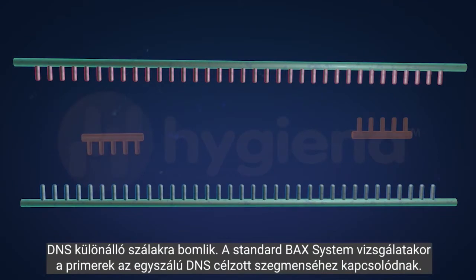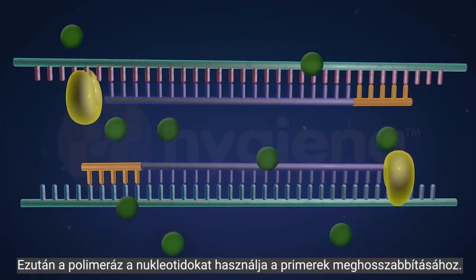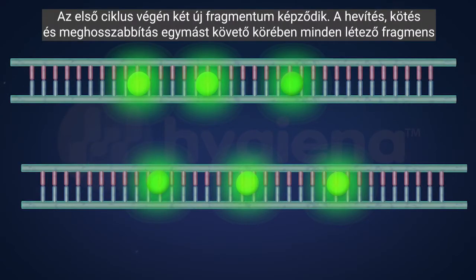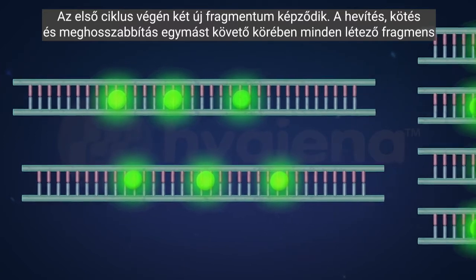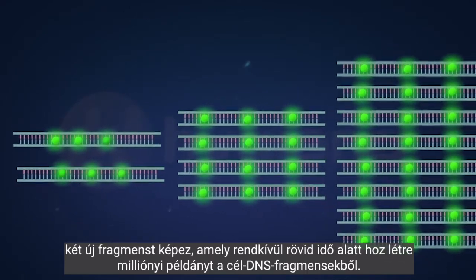For standard BAX system assays, the primers anneal to the targeted segment of the single-stranded DNA. Then, the polymerase uses the nucleotides to extend the primers. As the new DNA copy is created, the dye binds to the double strands, causing it to emit a fluorescent signal. At the end of the first cycle, 2 new fragments are formed. With each successive round of heating, binding, and extending, each existing fragment splits to form 2 new fragments. This creates millions of copies of the target DNA fragments in a very short time.